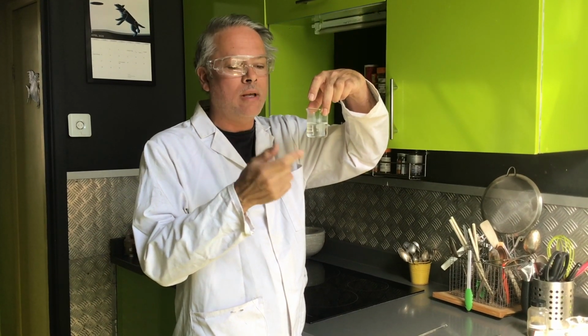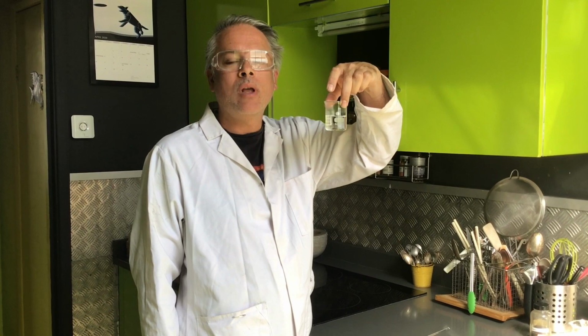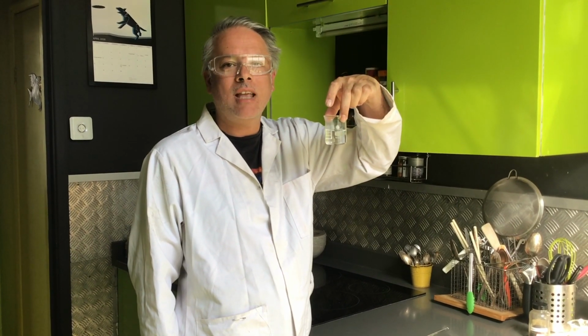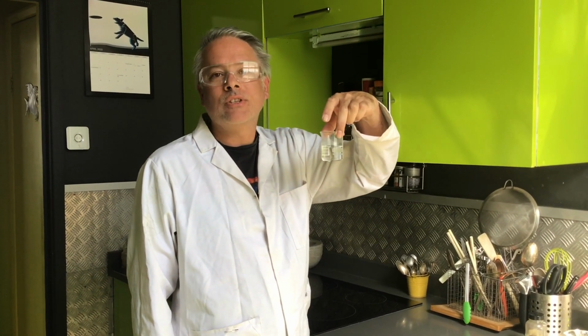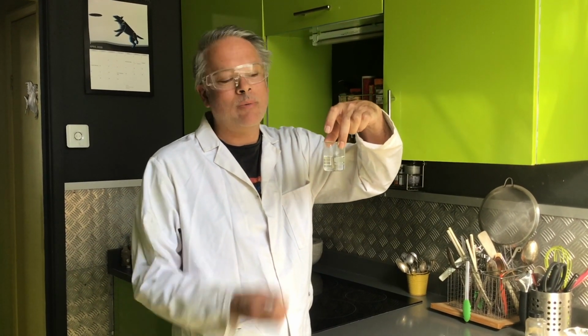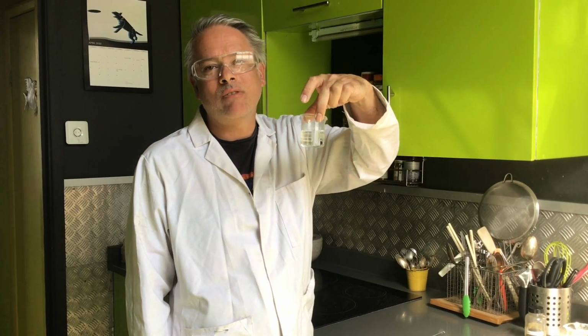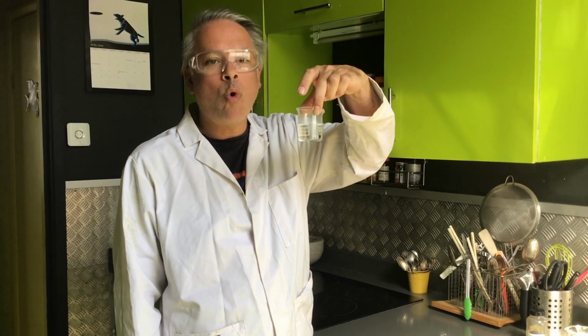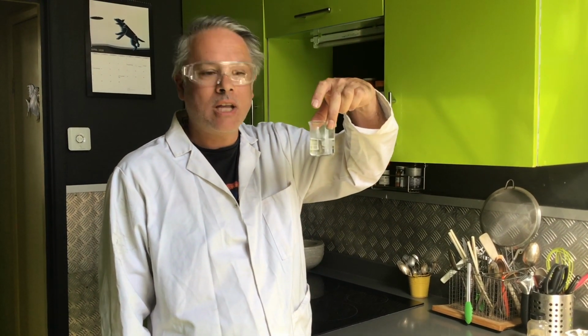If you don't warm it, it won't work properly, it won't react, but don't boil it, okay? I'm at home obviously, and I don't have a Bunsen burner, funnily enough, so I've just warmed it in a water bath. You'd use a Bunsen burner. Make sure you don't boil it. We don't want boiling acid going everywhere. Obviously that would be rather unpleasant. So just warm it, and once it's warm, you can add your copper oxide to it.